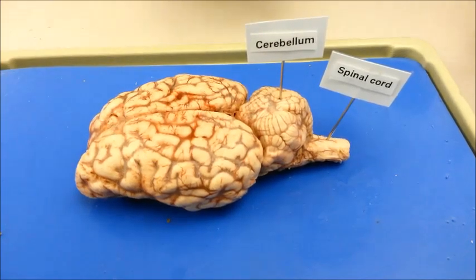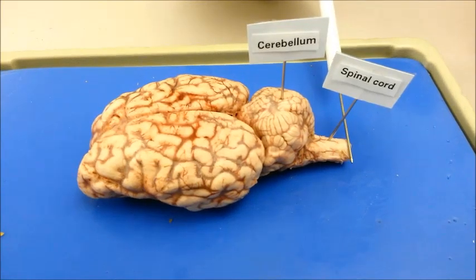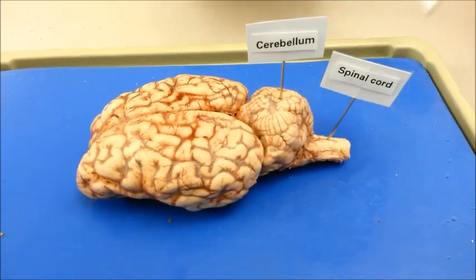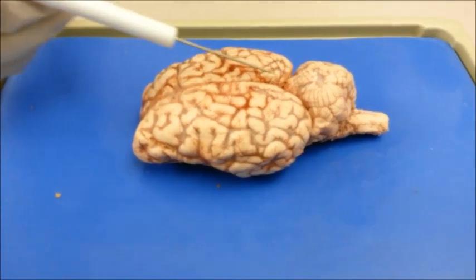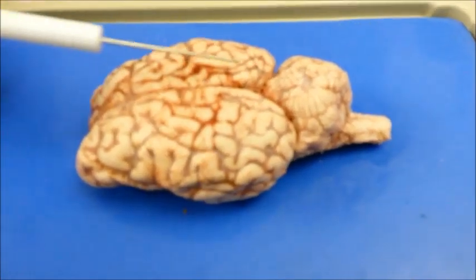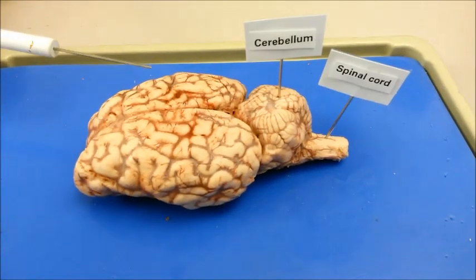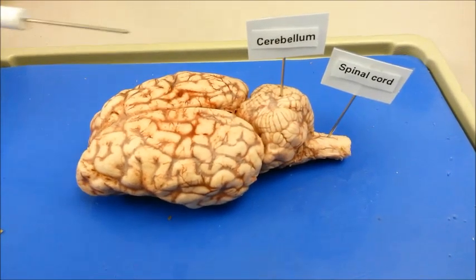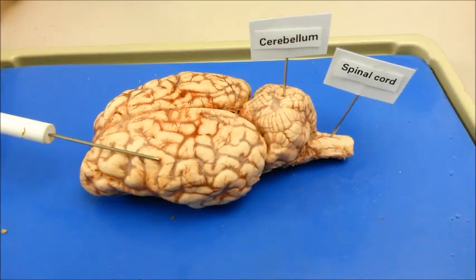The spinal cord is the connection between the brain and the body. Its main job is to send information to and from the brain. The longitudinal fissure is the portion of the brain that divides the left and right hemispheres. The right hemisphere is connected to creativity, while the left hemisphere is linked to the process of logical reasoning.